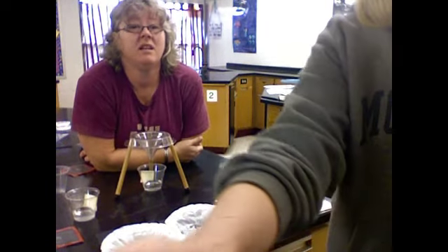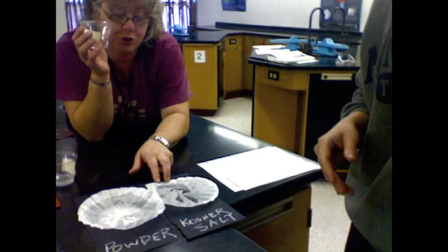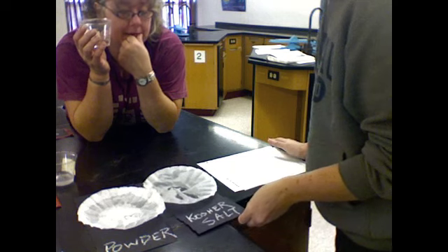When I compare that to the other one, the powder one, I can't see anything besides water. Yeah. Powder I can tell worked. So now how do we do this? Well, I can't put my scientific seal of approval on this paper filter. I can't for sure know that this paper filter worked for separating the salt.